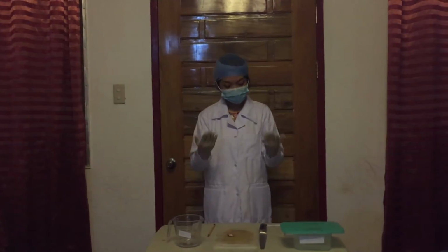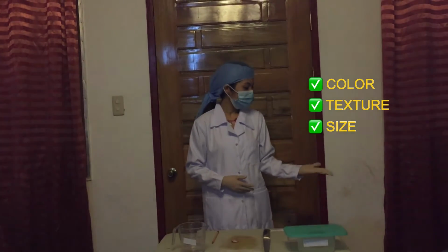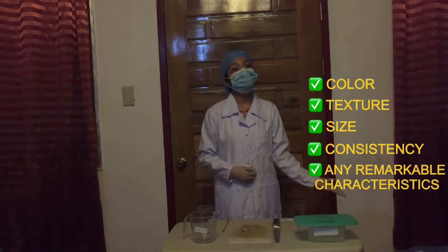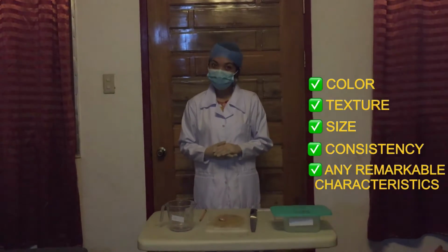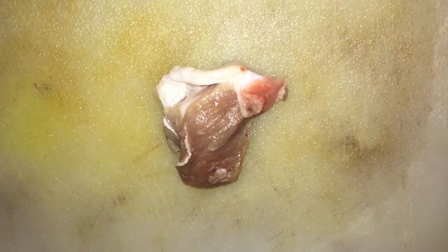We are going to do the gross examination. We will note its color, texture, size, consistency, and any remarkable characteristics that are displayed by the tissue. Take note that this can only be done by the pathologist. However, there are also times that medtechs who were trained in histopathology can do the gross examination but are only limited to small specimens. Remember also to never ever touch the specimen if the pathologist or assigned medtech was still not able to perform gross examination on the tissue.